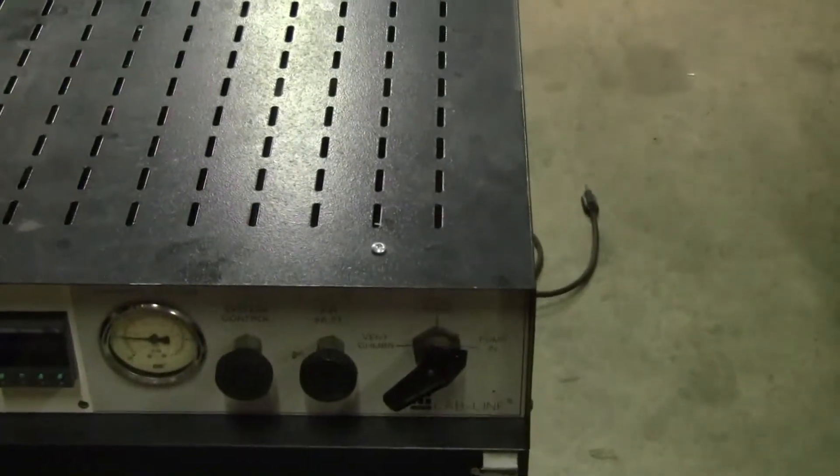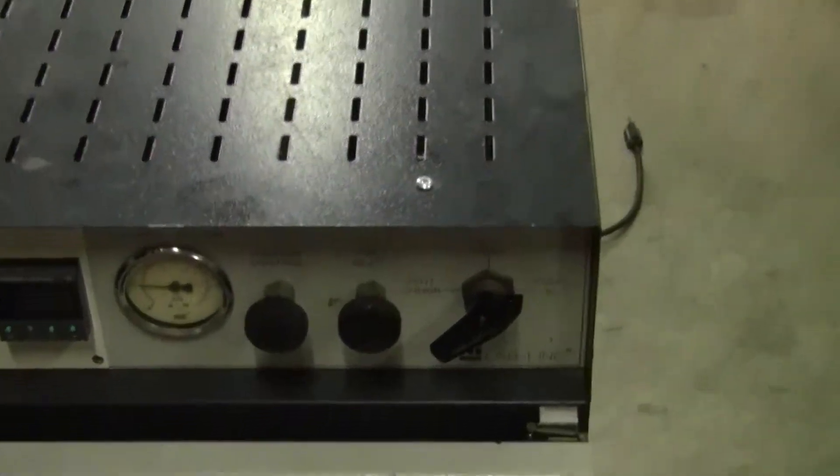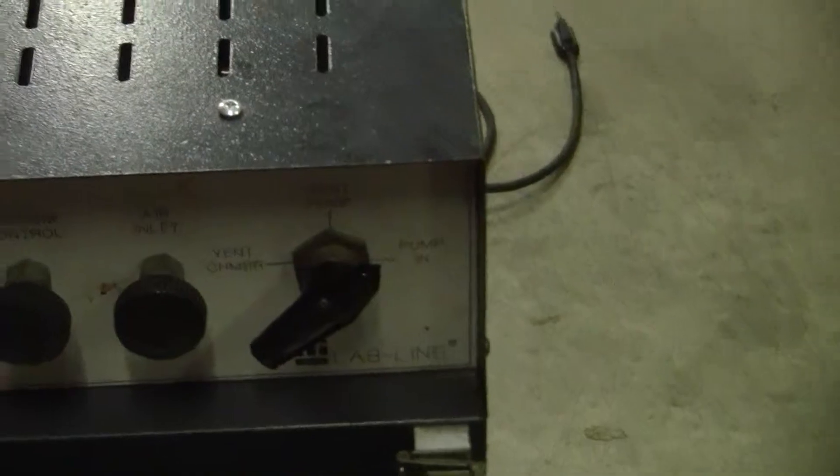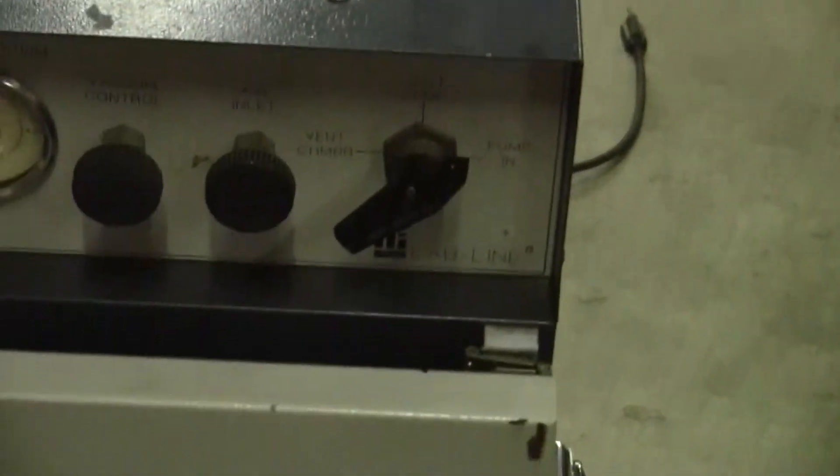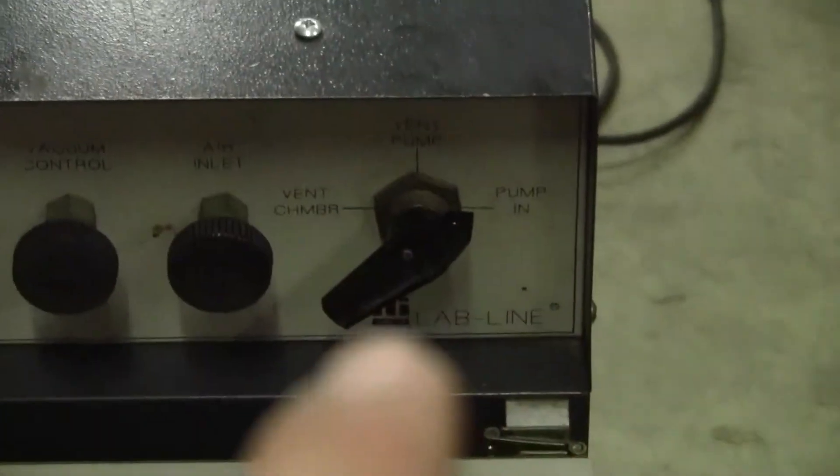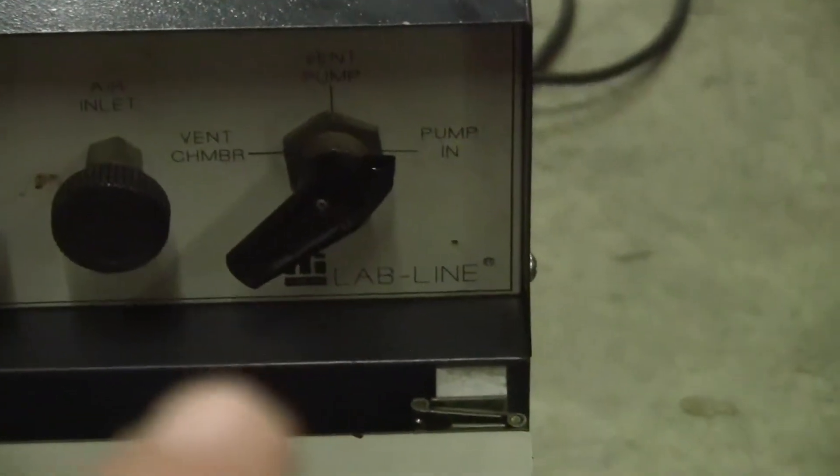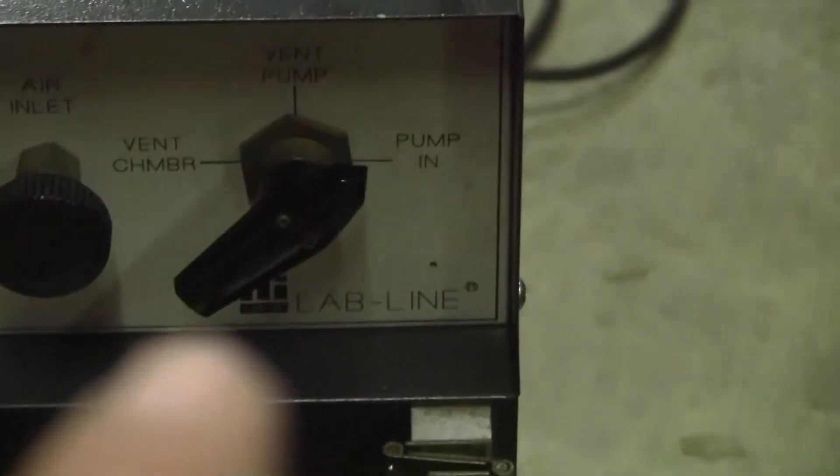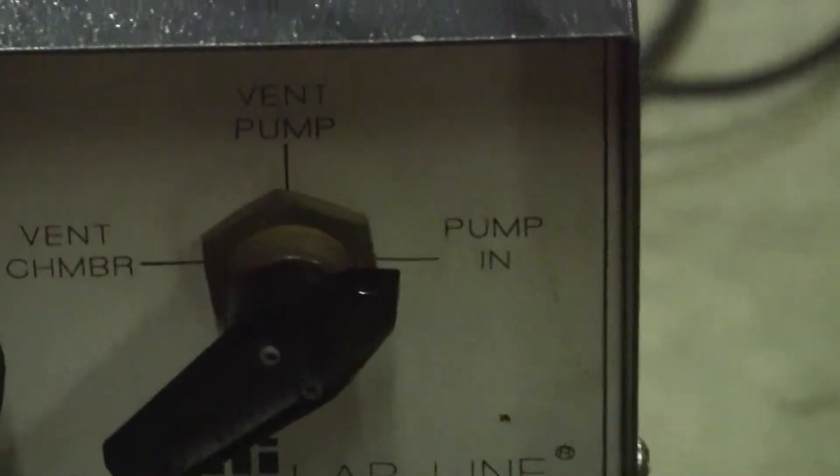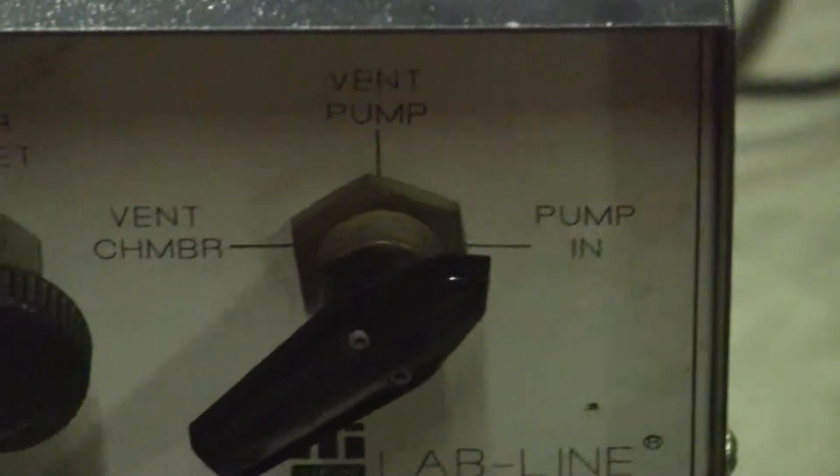Your air inlet, your vacuum controller all the way turned to the right. You'll note that the other valve, I've put it in like a 45 degree position just to mark it closed.